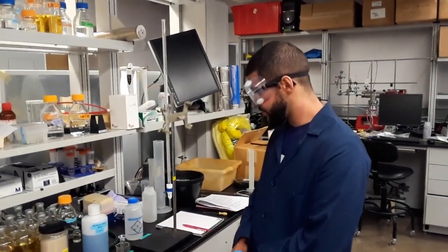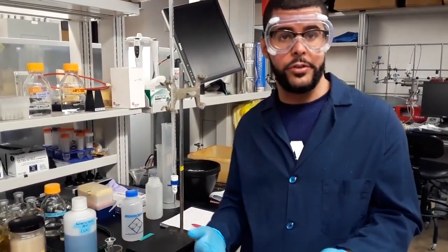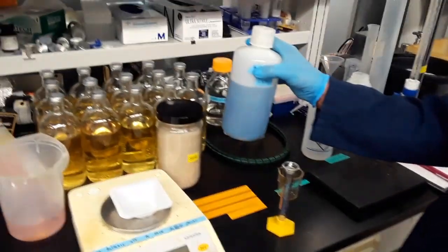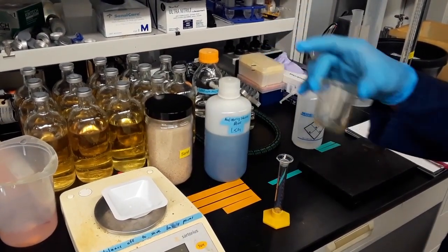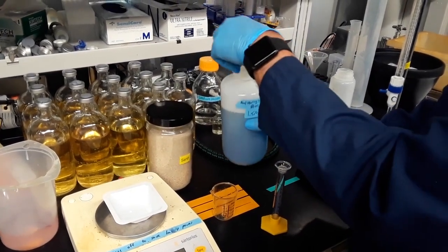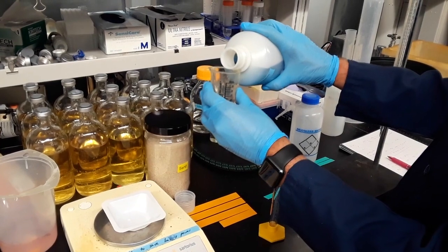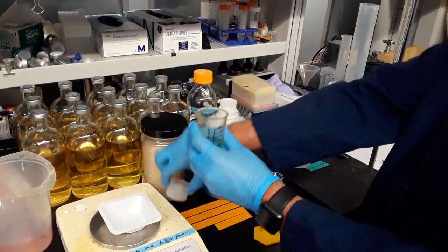Okay, so now we are going to go ahead and practice how to measure out food coloring and make our dilution. Now keep in mind that we're going to have this stock bottle in the back. And so your students, make sure that you tell them to get a small beaker and just fill it with a small volume of dye and take it back to their table. And I will do just so. So I'm going to pour just a little bit so as not to waste the dye.